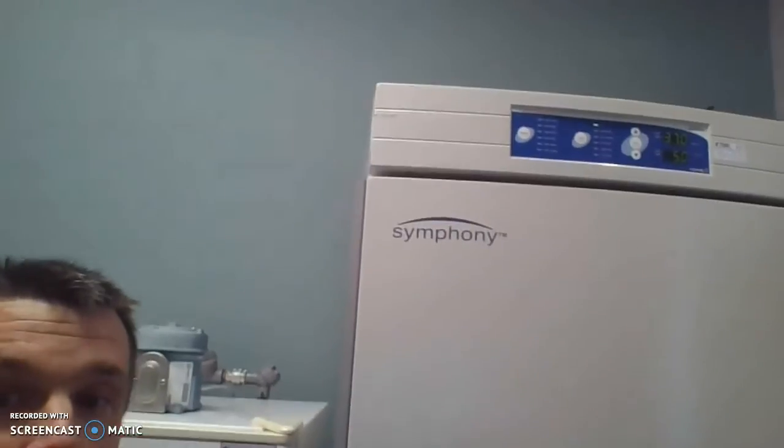Here we have our tissue culture incubators, and these incubators hold 37 degrees, but they also hold 5% CO2, and that 5% CO2 is really important because it seems pretty high. Natural air is usually less than 0.5%, certainly less than 1 or 2% CO2. But in our body, where our cells are doing cellular respiration and producing CO2, the cells are naturally in about a 5% CO2 level. And that's important because that's why CO2 diffuses away from our cells into our bloodstream and out of our body.